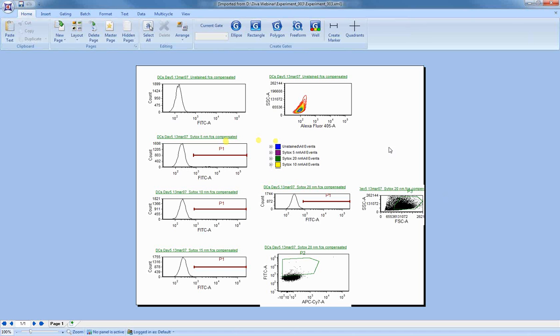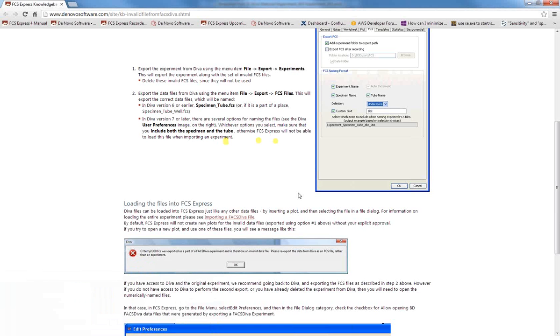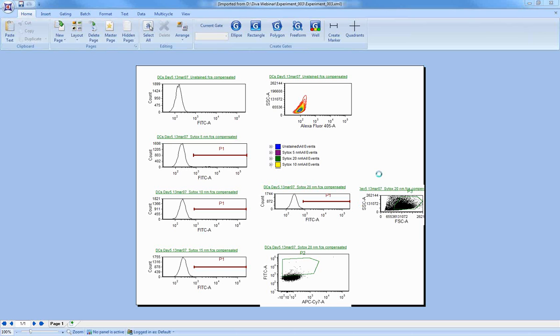Let me just move over and show you what that dialog would have looked like. Inside Diva 7, when you do the export, you have several options here. You can do the experiment name, the tube name, the specimen name, and even put your own custom text here. As long as you include the specimen name and the tube name, FCS Express will be able to find it. So let's go back to normal pen and come back to FCS Express.